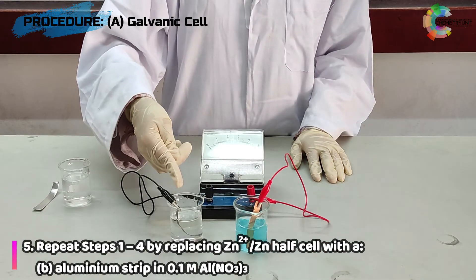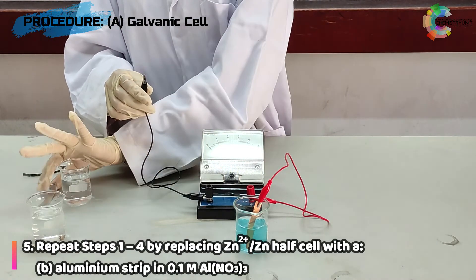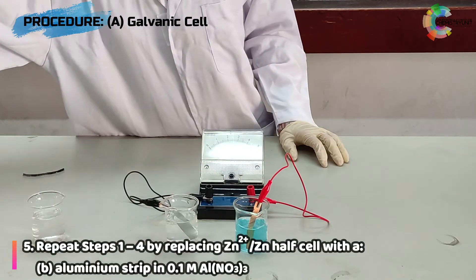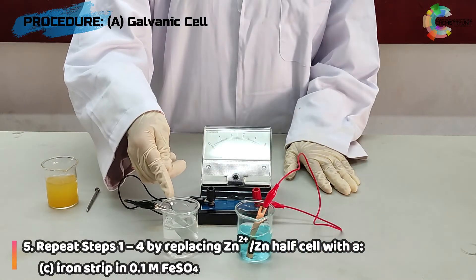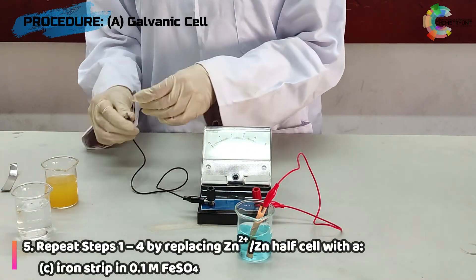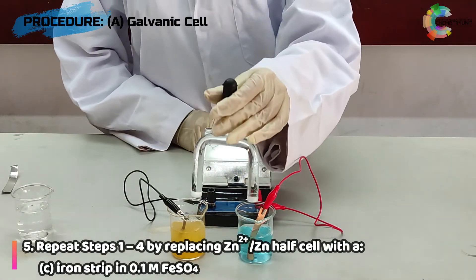Repeat steps 1, 2, 3 and 4 by replacing the zinc half-cell with aluminum strips in 0.1 molar aluminum nitrate solution. Repeat steps 1, 2, 3 and 4 by replacing the zinc half-cell with iron strips in 0.1 molar iron sulfate solution.